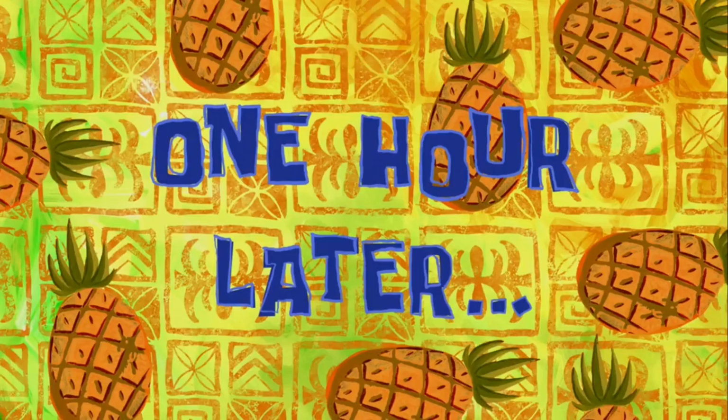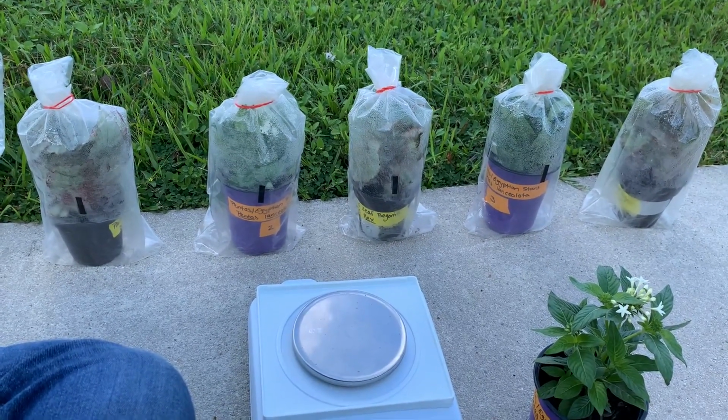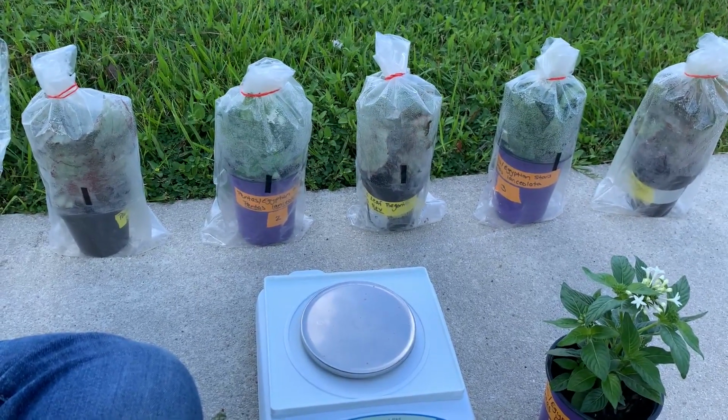One hour later. Okay, we are back outside. 2 hours have now passed, and I'm about to start taking the mass for all of our plants.